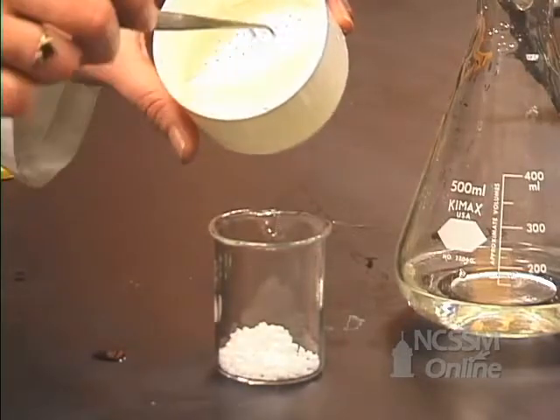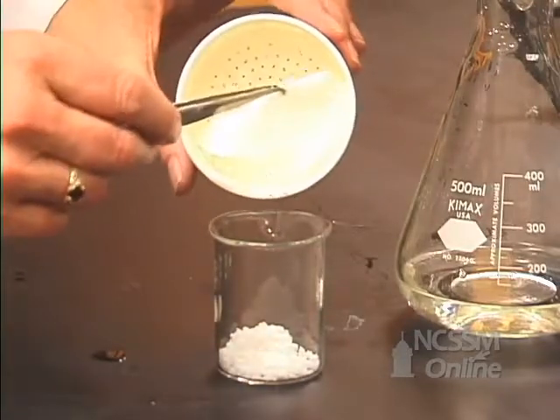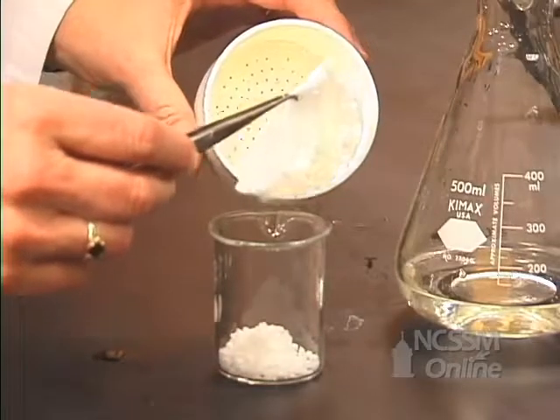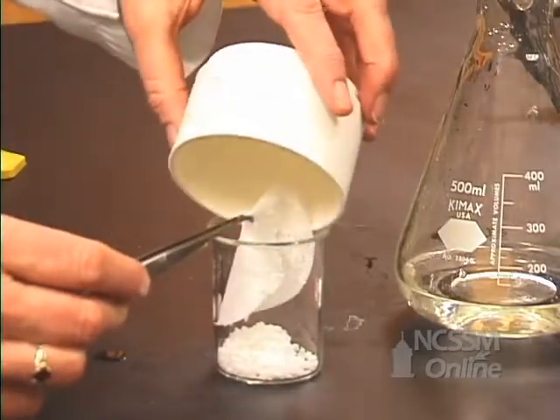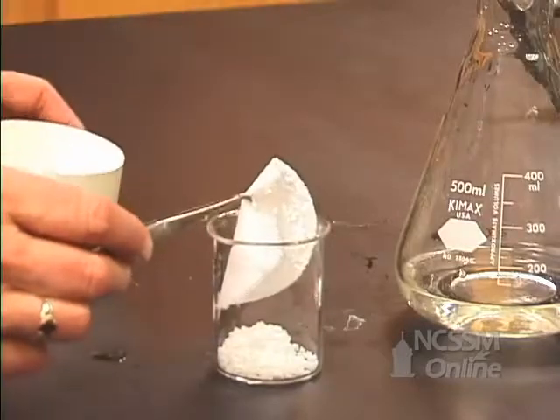Since we want to make sure we get it all, we're going to lift the filter paper into our beaker. And then we're going to rinse this with alcohol.